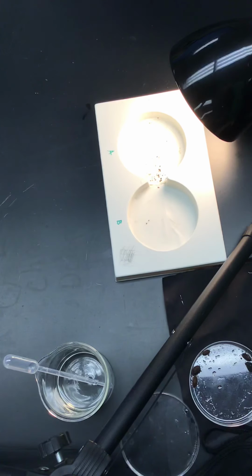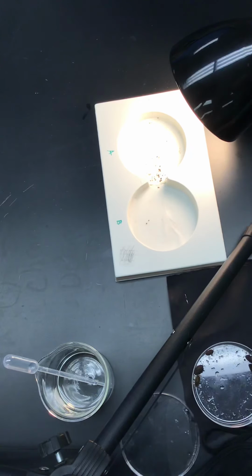So, what we're going to do today is test if pillbugs prefer a light or dark environment. Again, since they are usually found buried in the ground, we might hypothesize that more would prefer the dark environment. So for the light versus dark lab, we are actually testing their sense of sight. So let's design our experiment.